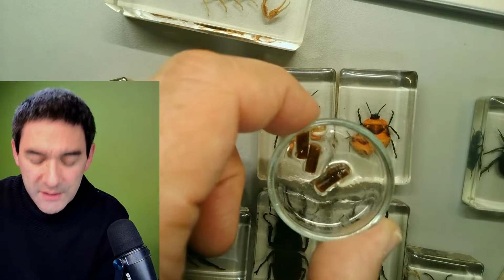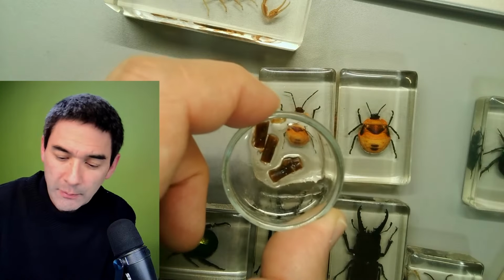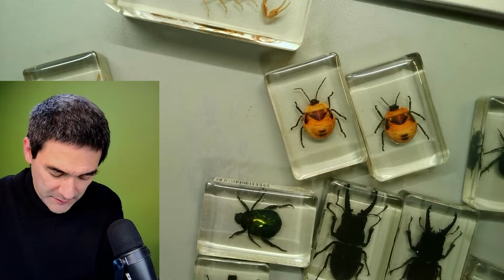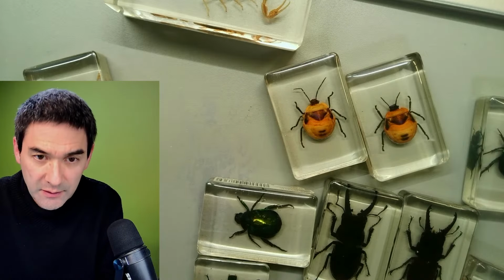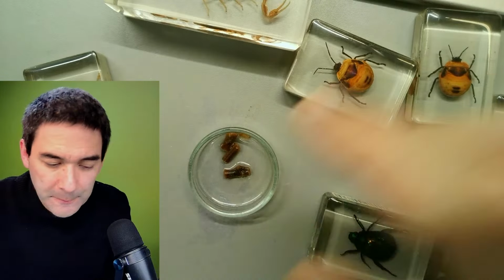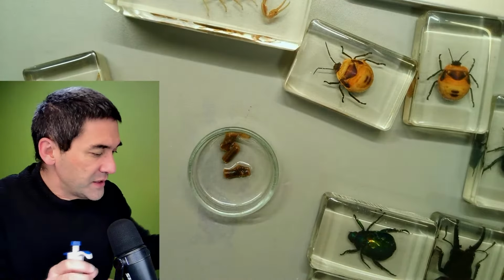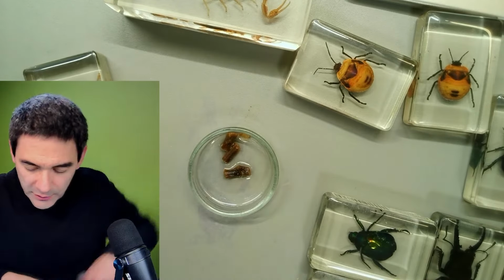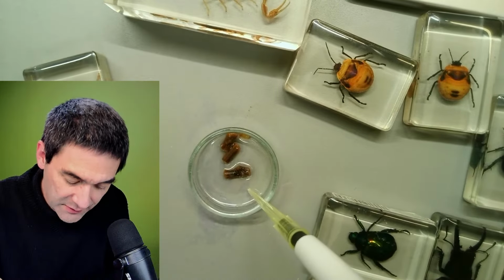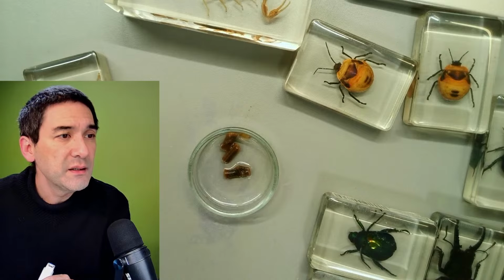Do you remember this? That's the oak wood from last week. And what I'm going to do now is the following. It's a little bit greasy, the whole thing. I'm going to just take a sample from here and put the glycerin on top of the resin. Okay. Let's see if this works.